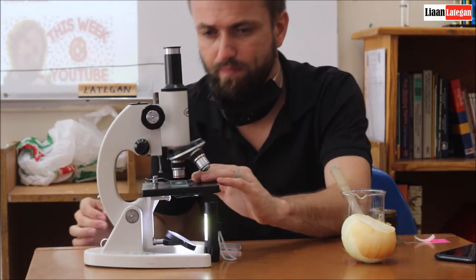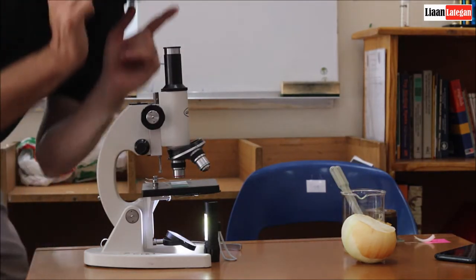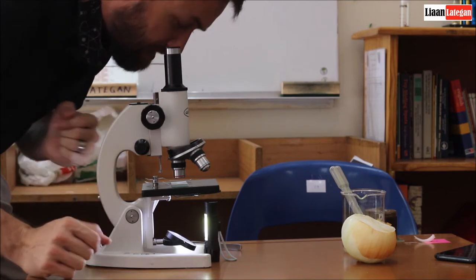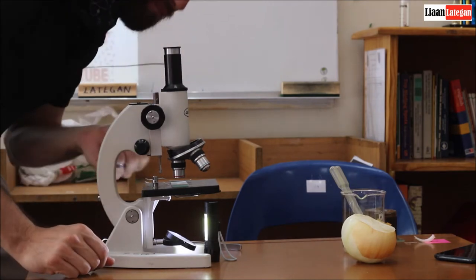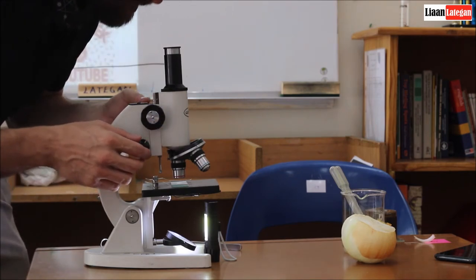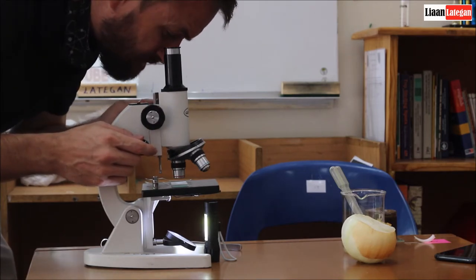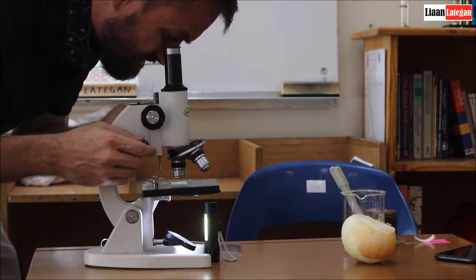Then what is important? I want to make sure that when I'm looking through the eyepiece, I have a clear picture. In order to adjust that, there are two controls. The height and to refine it. So I want to make sure that the height is just right.